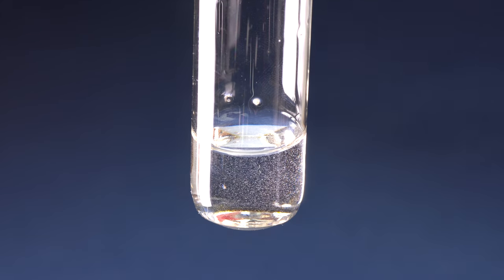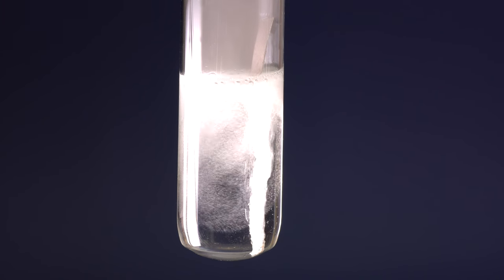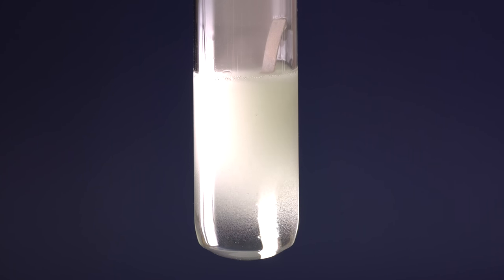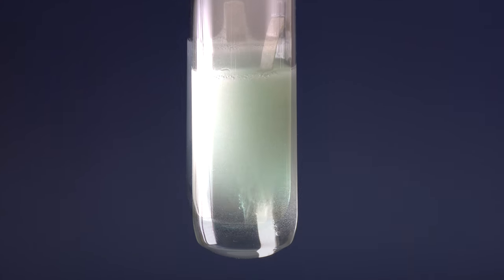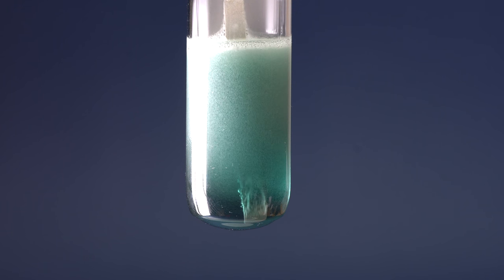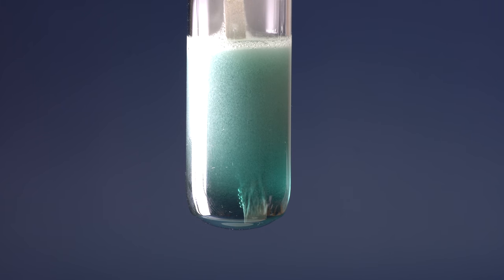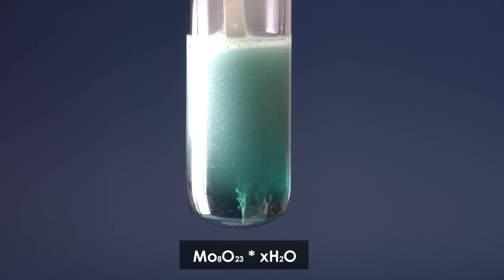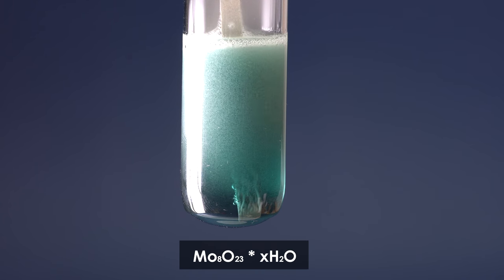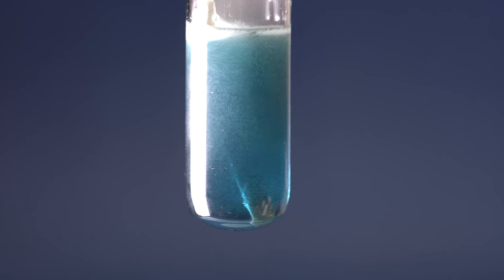If such a solution is made more acidic with hydrochloric acid, and if a piece of magnesium is added to it, the hydrogen produced as a result of the reaction will reduce molybdenum in the solution, producing so-called molybdenum blue. This compound consists of molybdenum oxide fine particles with different oxidation states.